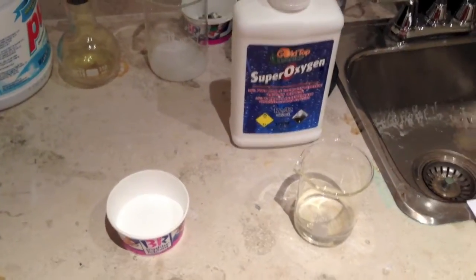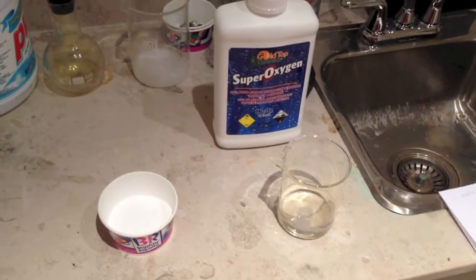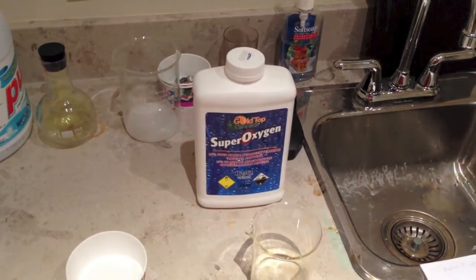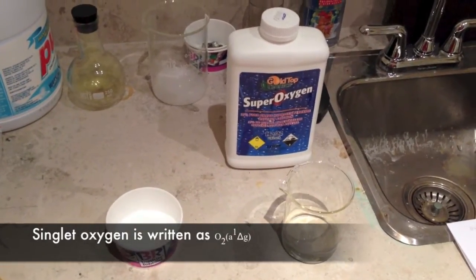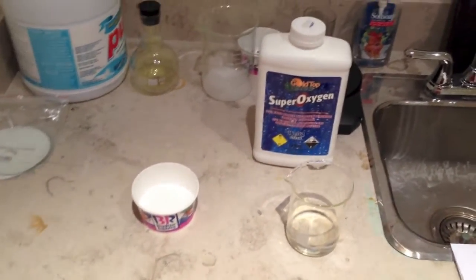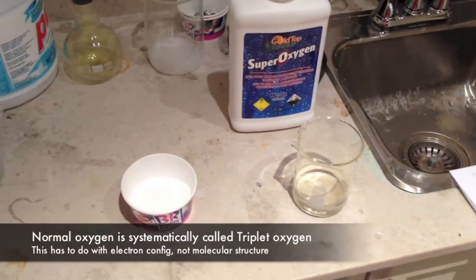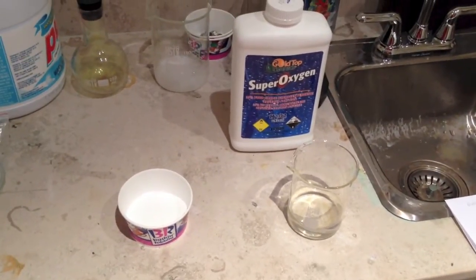Contrary to what the name implies, singlet oxygen is still a diatomic oxygen molecule. However, the electron configuration of singlet oxygen is at a higher energy state than normal. When singlet oxygen is formed, it decays immediately into normal oxygen. And to go from this higher energy state to a lower energy state, it emits red light. So hopefully we'll see this in action.